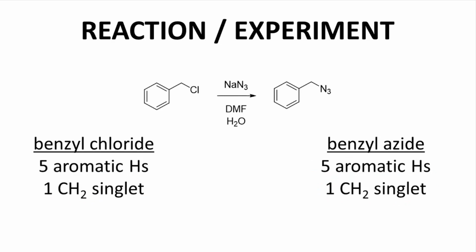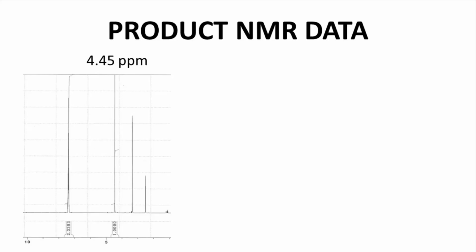Look at these two structures one more time. First, benzyl chloride. Second, benzyl azide. I'll refer back to each of them regularly in this video. To the left is the spectrum of the reaction product. The key signal is the CH2 singlet at 4.45 ppm.